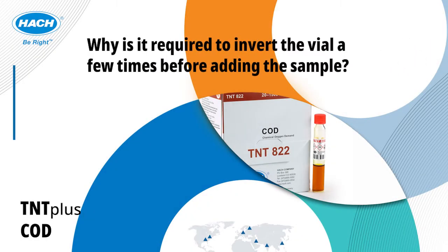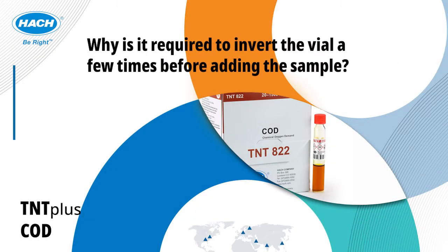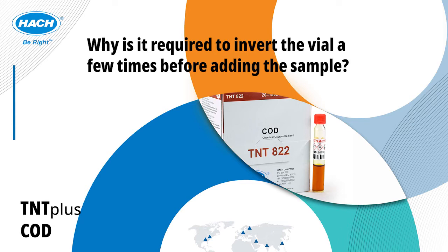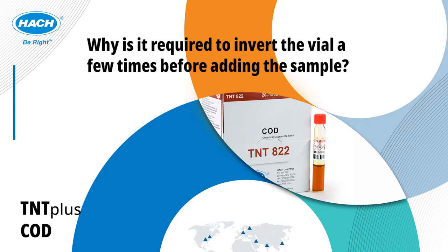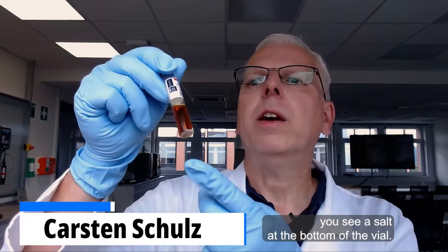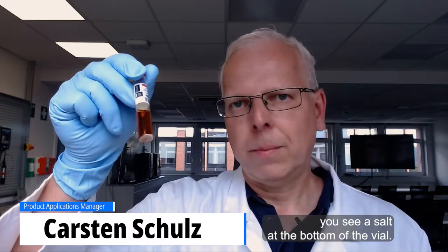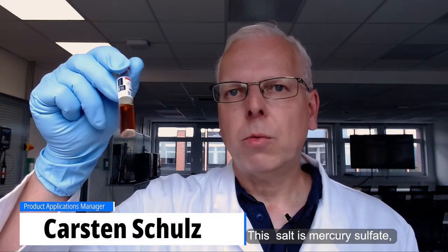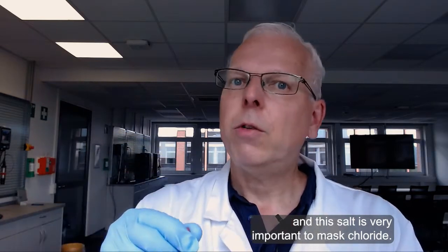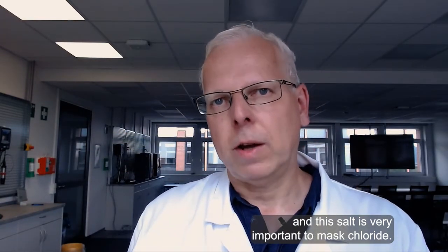The first question is about why we should invert the vial before adding the sample. When you look at the COD vial, you see a salt at the bottom of the vial. This salt is mercury sulfate, and it is very important for masking chloride.